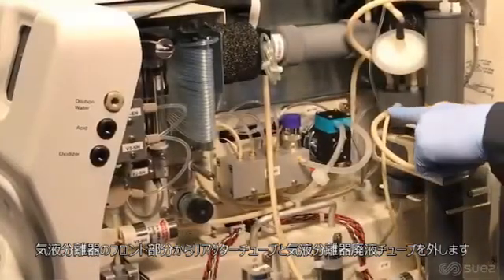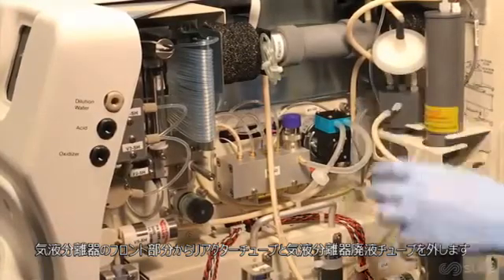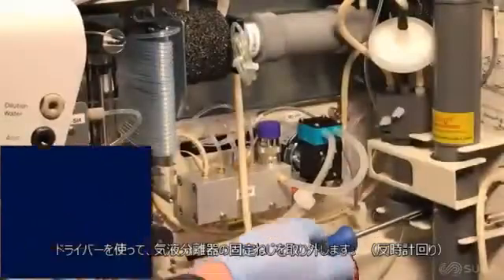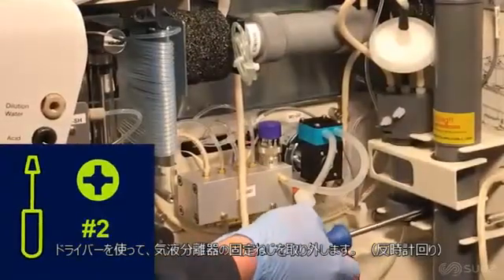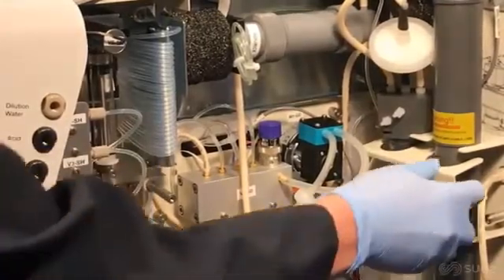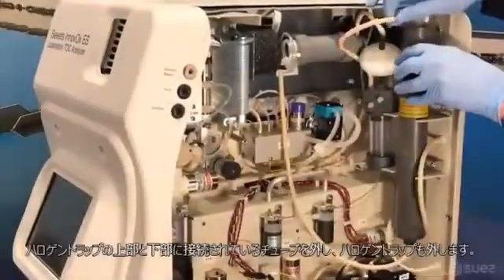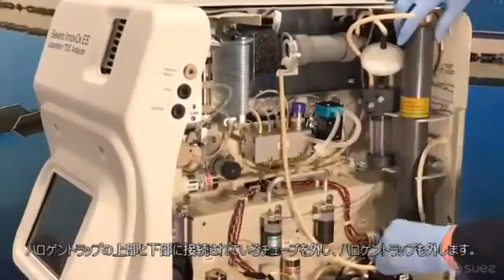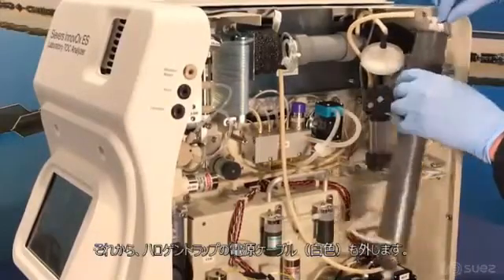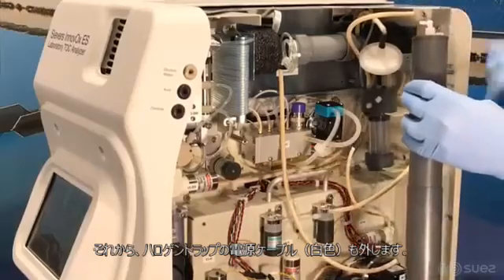Disconnect the pinch tubing extending from V7R and the waste tubing from the front of the gas-liquid separator. Using a number 2 Phillips head screwdriver, remove the retention bracket by turning the captive mounting screw anti-clockwise. Disconnect the waste tubing from the bottom and top of the halogen trap. Then, using your thumb to release the white connector, remove the halogen trap power cable. Set the halogen trap aside for reinstallation.